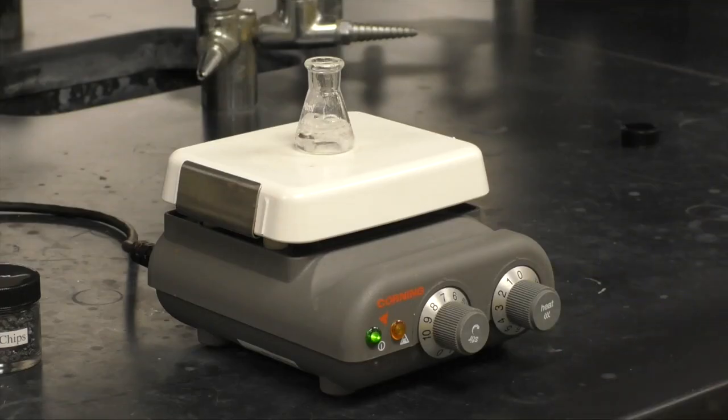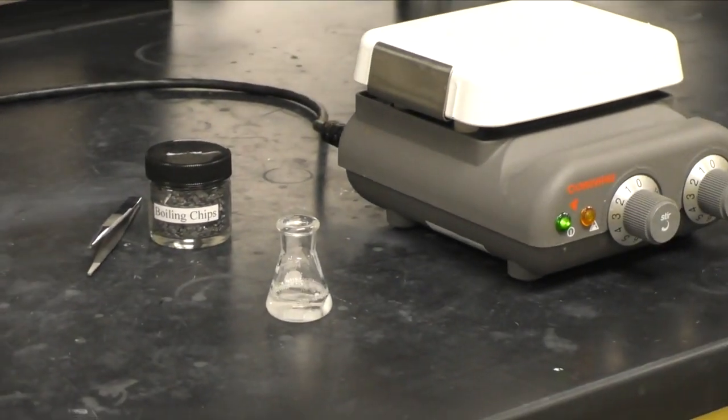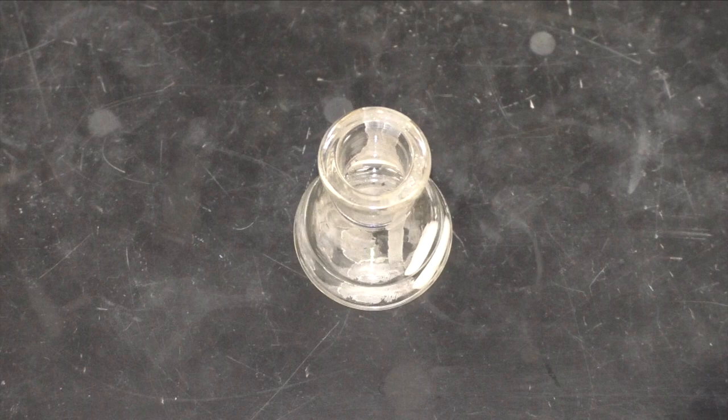Once the solution is boiling, remove the flask and allow it to cool to room temperature. Crystals will form.